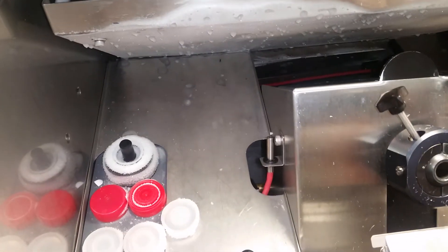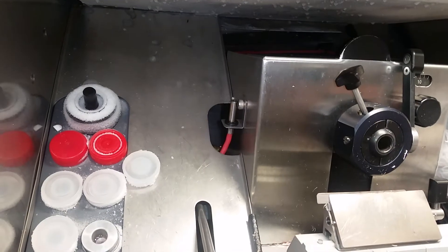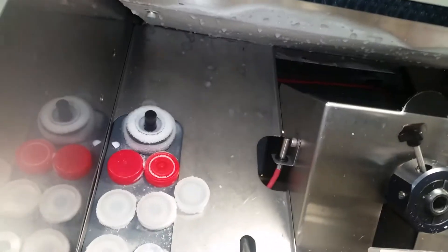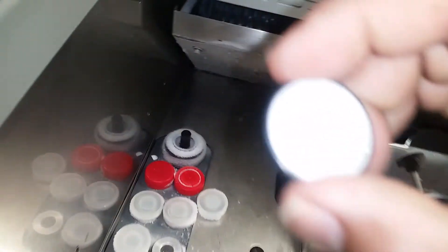I'll take a little OCT and put it right there. I need to catch it before it runs off because I'm one-handing this. So I've got a little OCT on there — right there, there we go. I'm not going to cut, so we've got OCT applied.